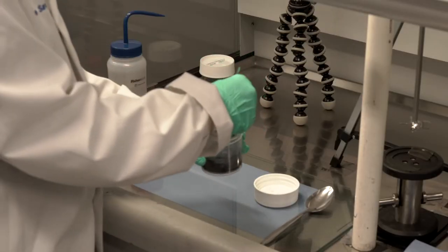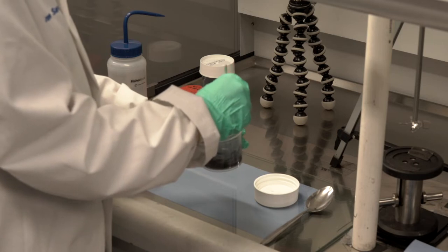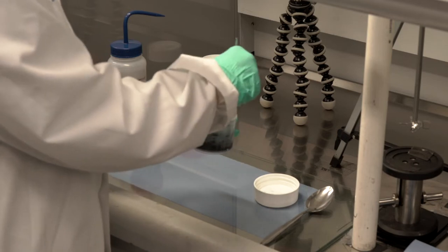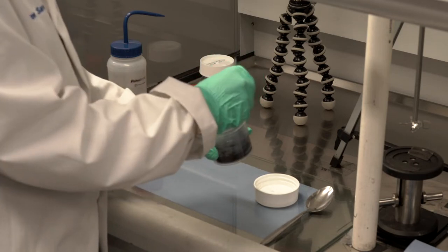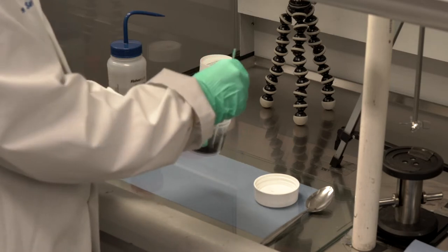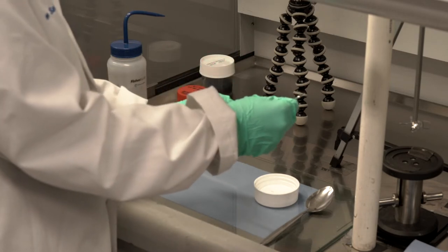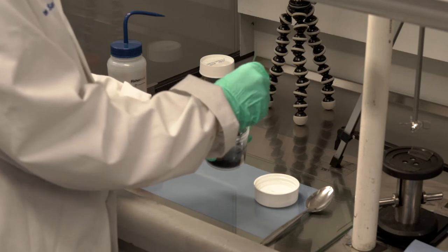Okay, I've just about wetted all of the dry clumps that were floating on the surface of this now very inhomogeneous suspension. It's time to put it in the mixer.